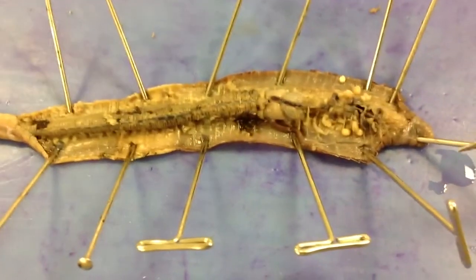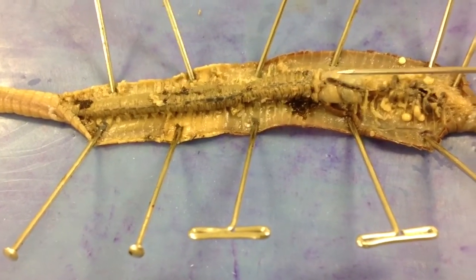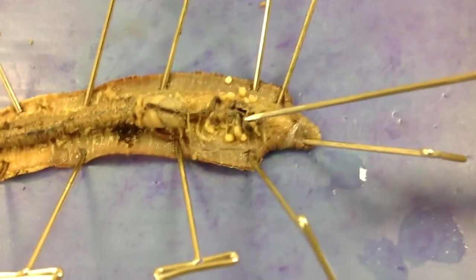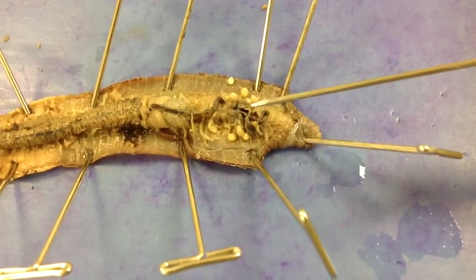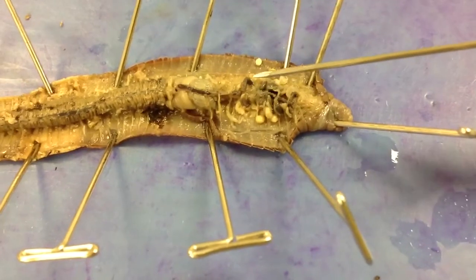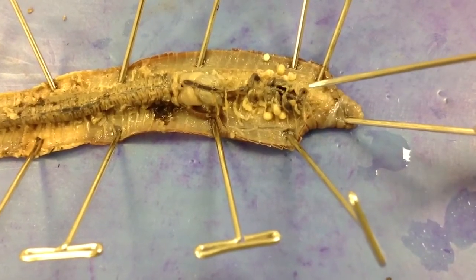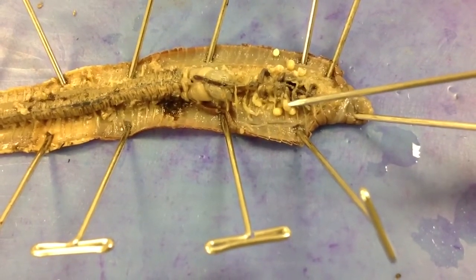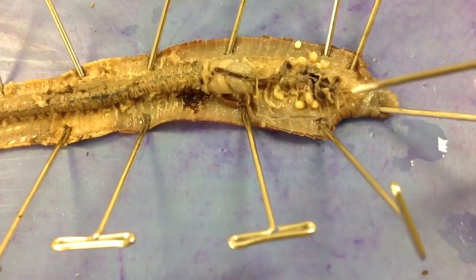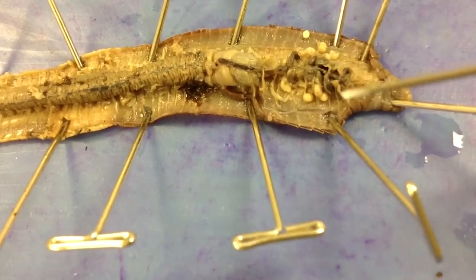The other thing you can see very clearly is this dark line running through here — that is the dorsal blood vessel. You can also see the aortic arches, or the pairs of hearts. Annelids have five pairs of hearts: one, two, three, four, five. The pairs of hearts connect the dorsal blood vessel to the ventral blood vessel, and blood runs one direction through it — down one side and up the other, pumped by these aortic arches.